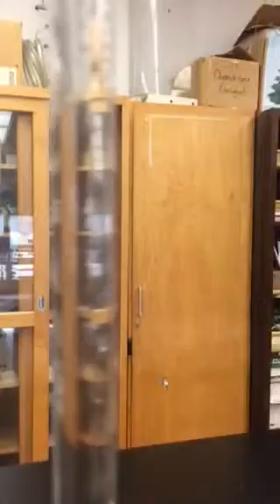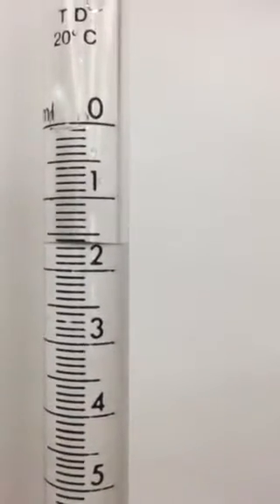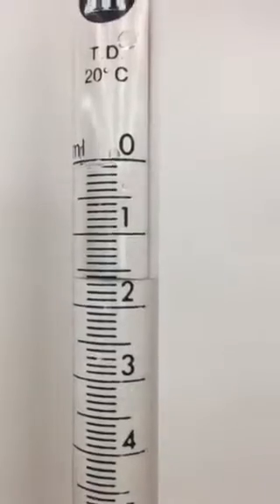We need to move up to the top of the burette. As you'll recall, these are calibrated with zero at the top and 50 down at the bottom. I'm going to put a piece of white paper behind this burette so that I can read it, and when I get it at eye level, that reads about 1.65 — somewhere between the sixth and the seventh mark between one and two. 1.65.